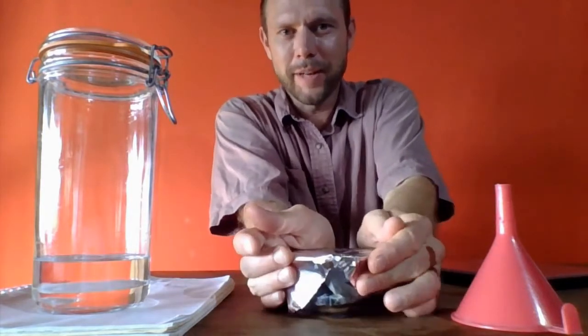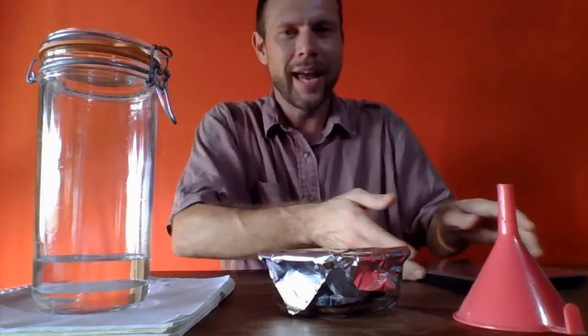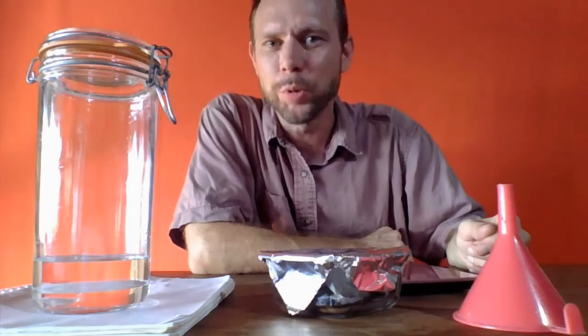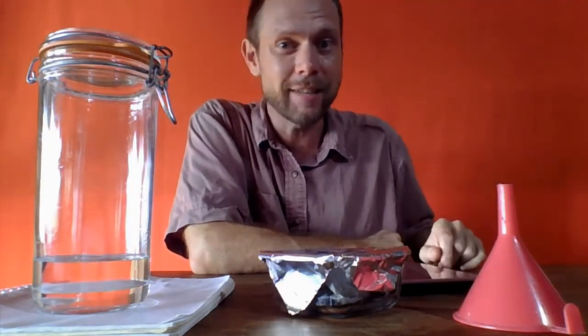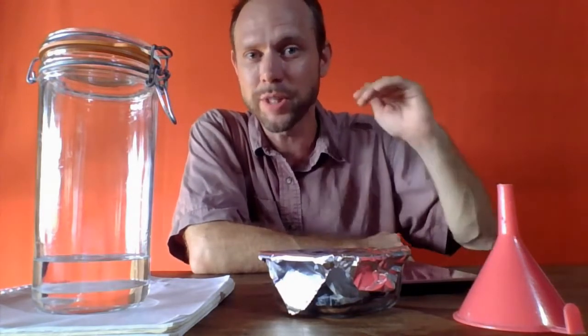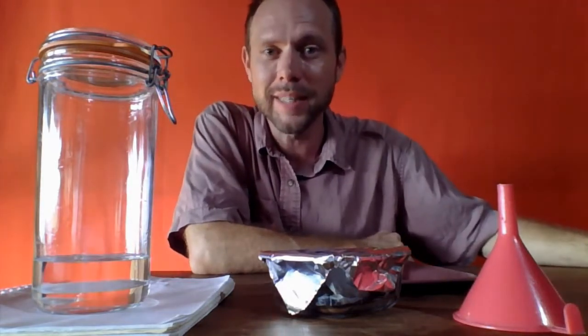And there is some paper in there. I don't want to heat it at a very high heat, but I'm just going to let this sit in the oven on medium heat for about an hour or so. Afterwards, we'll weigh it with the sand still in it, and we'll take the difference of those two numbers. It starts at 265 grams empty. We'll see what it weighs with dry sand in it. We'll subtract those two numbers, and we'll know exactly how many grams of sand we recovered in our separation.